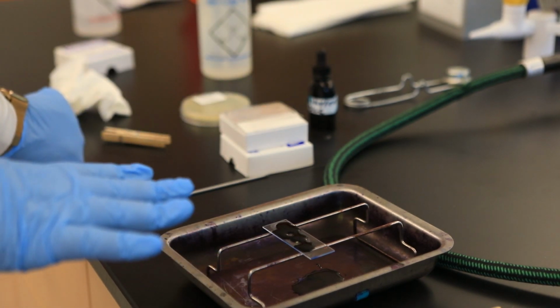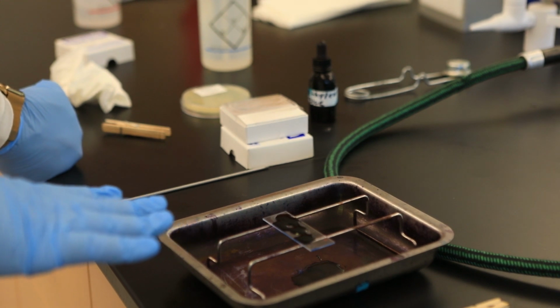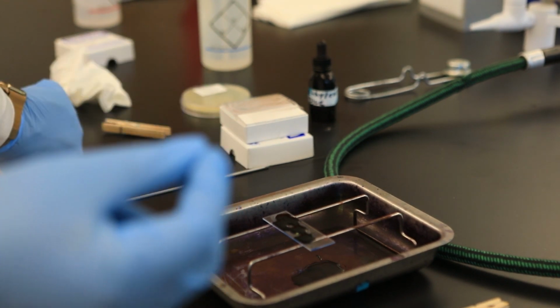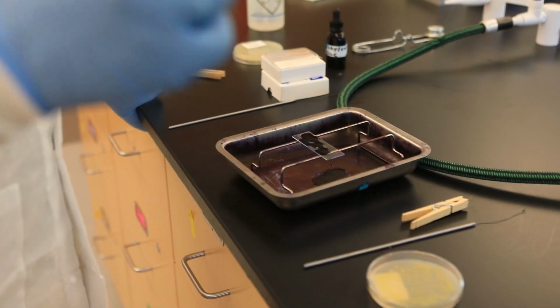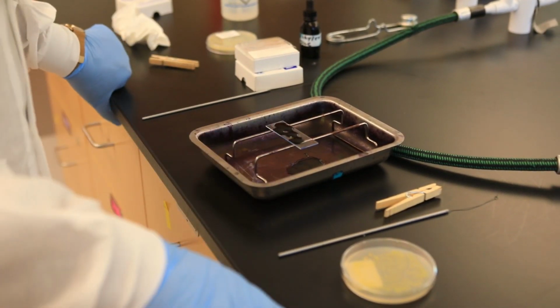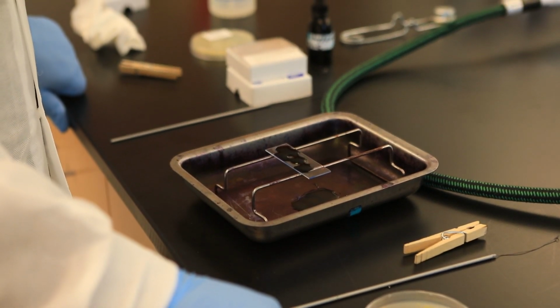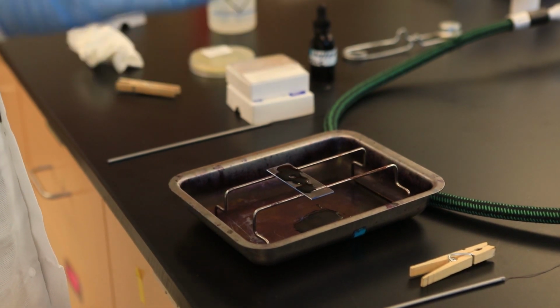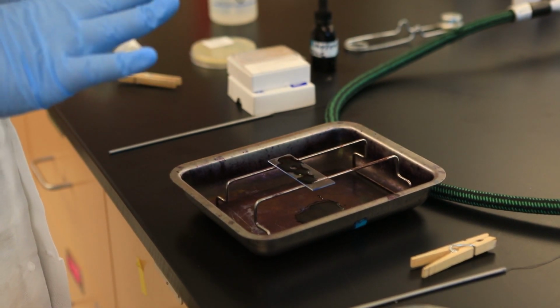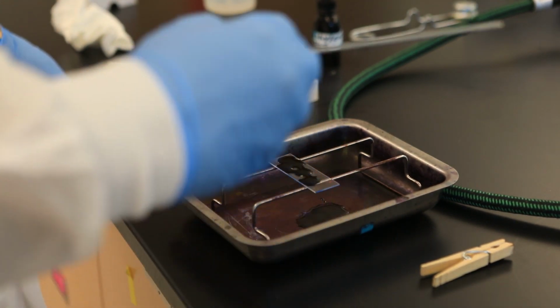For this particular type of stain, the time that the stain stays on is not so time sensitive. When you get to the gram stain, the differential stain, there could be some time sensitive reagents. But for this one, let's say we can leave it on there for 30 to 60 seconds, okay? So I like to leave it on for about 60 seconds just to give the stain enough time to penetrate the cells, okay? For the sake of time, I'm just gonna continue here.